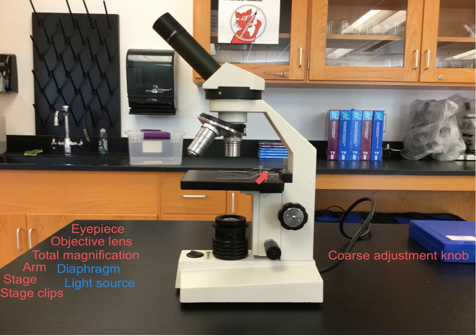It helps us focus on the specimen that is under the 4 times objective lens. It helps us to see clearly and focus onto the details that are in the specimen, and that process is called resolution, or you're resolving the picture or the specimen. So you only want to use the coarse adjustment knob when you are on a 4 times objective lens and nothing more than a 4 times objective lens. Otherwise, you might break an objective lens.